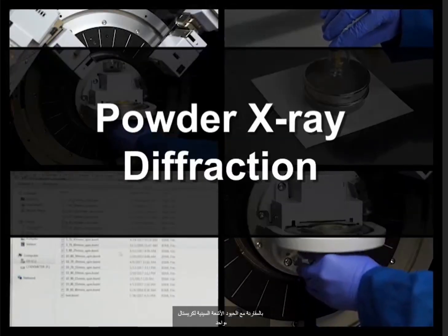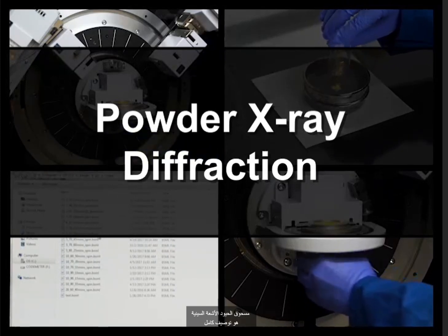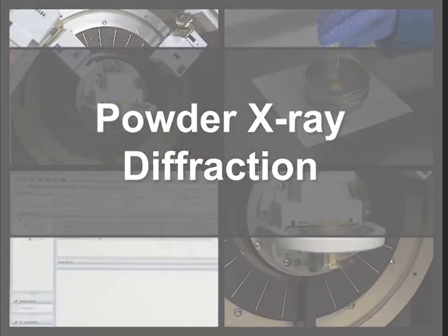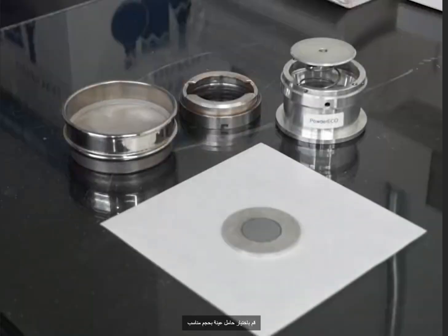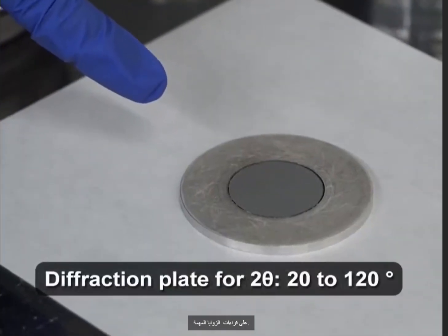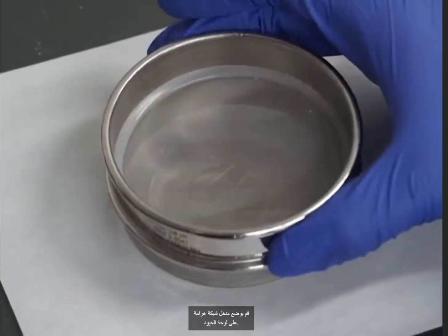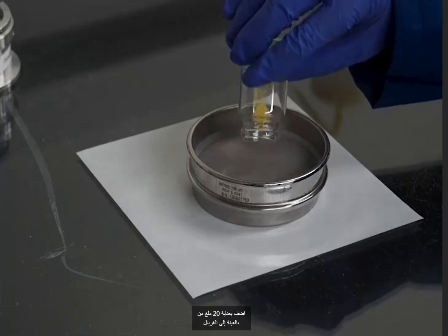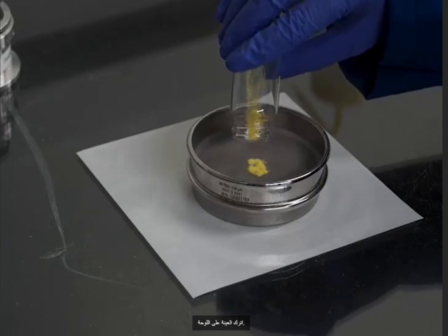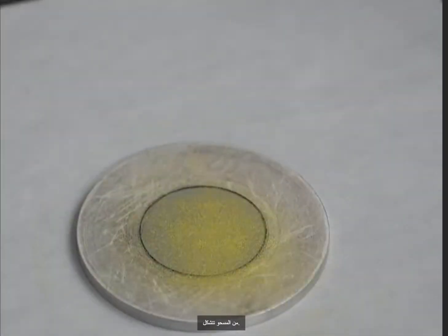In comparison to single crystal X-ray diffraction, powder X-ray diffraction is a bulk characterization technique that does not require single crystals. Choose an appropriately sized sample holder and a diffraction plate that will not affect the readings at the angles of interest. Place a fine mesh sieve over the diffraction plate. Carefully add 20 milligrams of sample to the sieve, keeping the sample over the plate. Tap the sieve on the benchtop until a monolayer of powder forms.